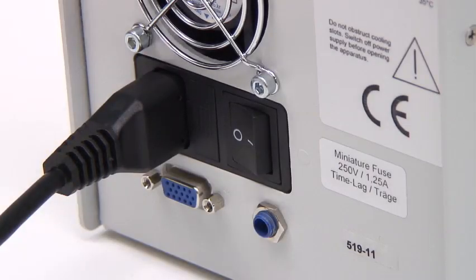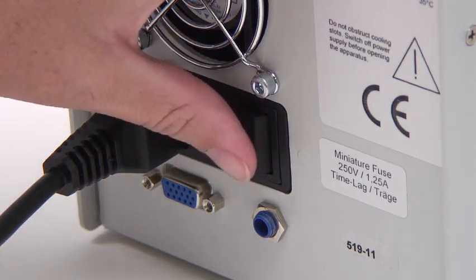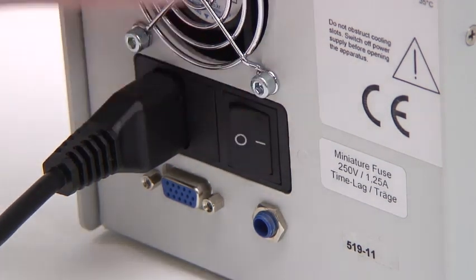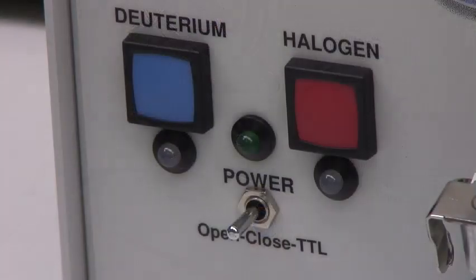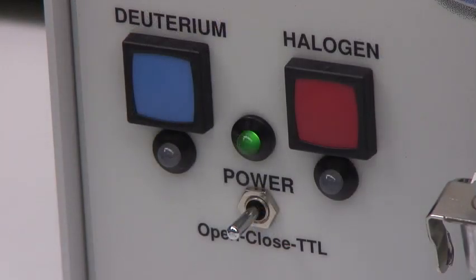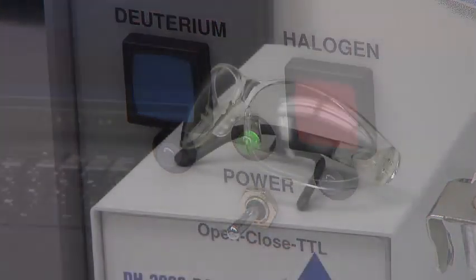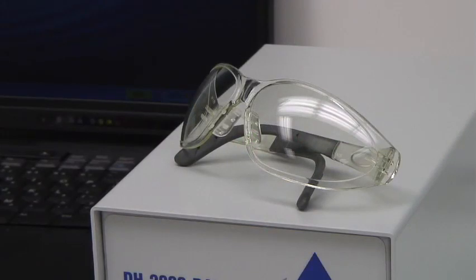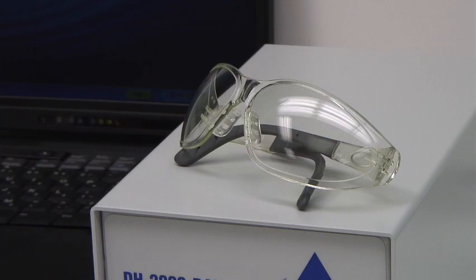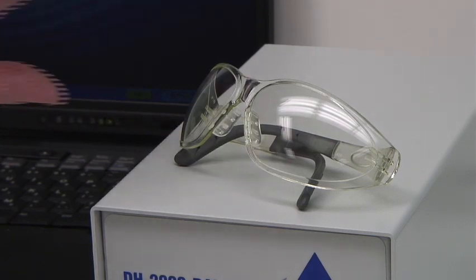Once the software is loaded, we'll power up the light source. Flip the power button on the back of the light source to turn on the unit. On the front of the unit, the green power LED will illuminate. Now put on the protective glasses that came with your light source. Safety glasses will protect your eyes from the UV output of the deuterium source.